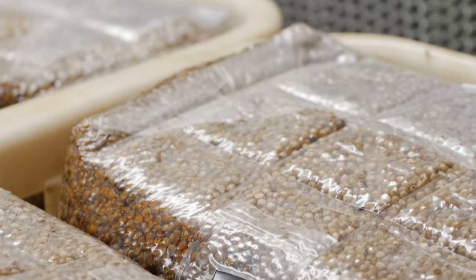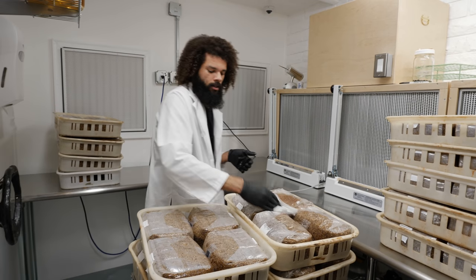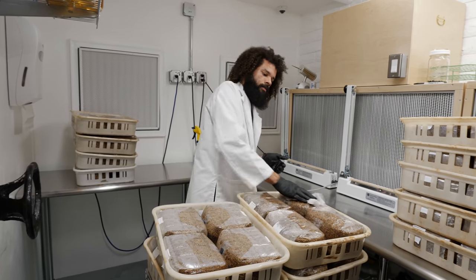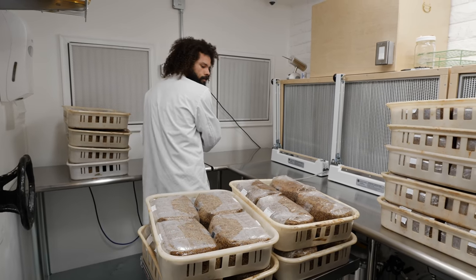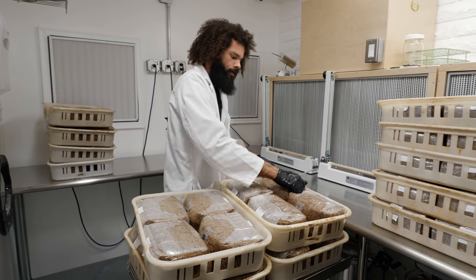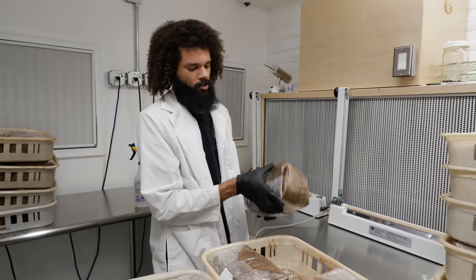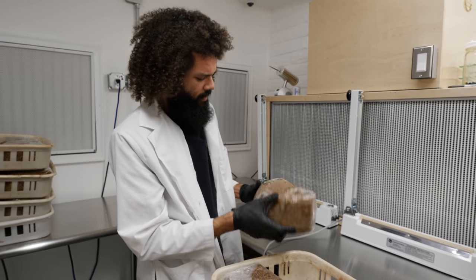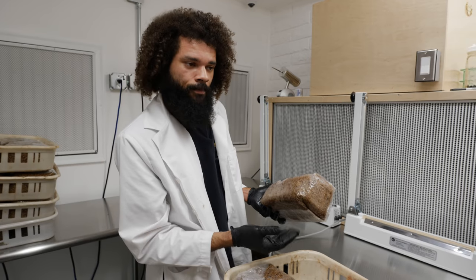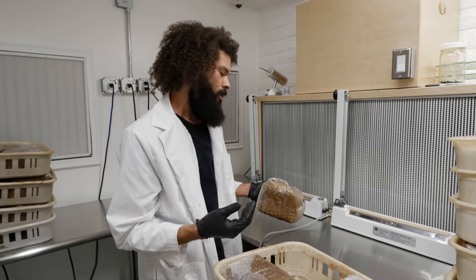Alright, so that's all the spawn. This is an old autoclave so it leaves a little bit of residue on the bags that I'll just wipe off. These are sterilized spawn bags — this is how our grain spawn comes out. It's composed of milo or sorghum, which is my preferred grain for making spawn.